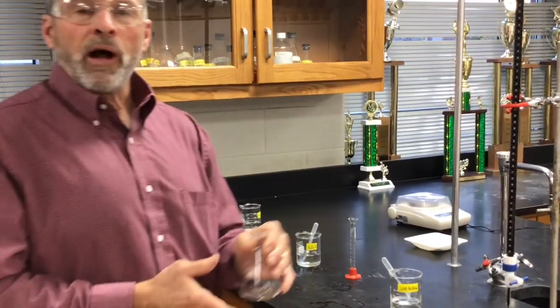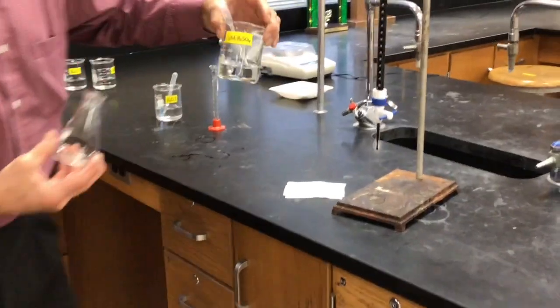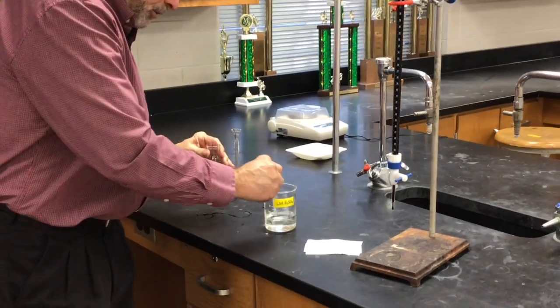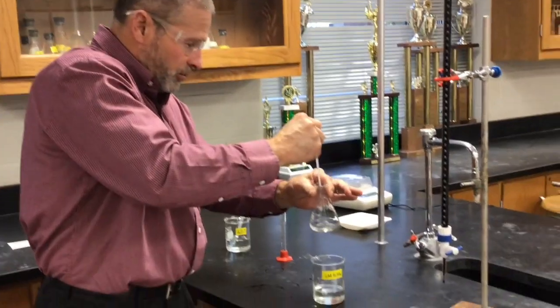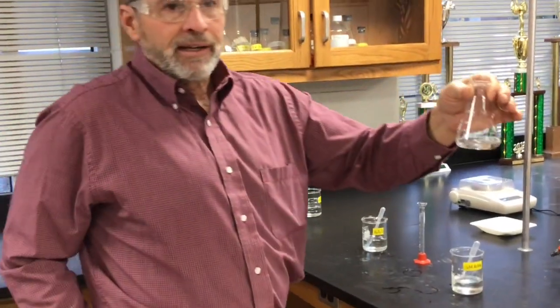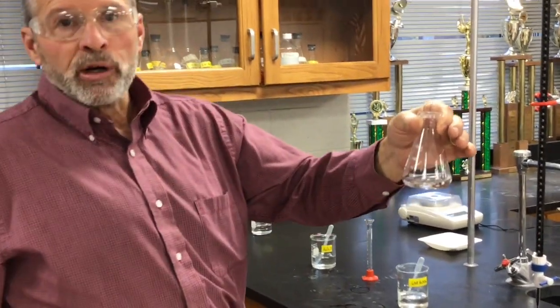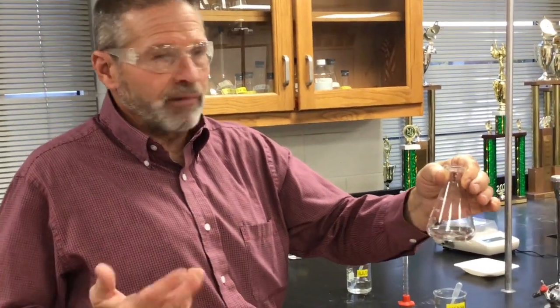Now, as you well know, these aqueous redox reactions tend to be in either an acidic or a basic solution. This one has to be acidified to work. And so Mr. Moore made up some 6 molar sulfuric acid, and we're going to give a couple good healthy squirts because we need hydrogen ions to make this reaction work. So you're not measuring the sulfuric acid. Right, we don't need an exact volume of it, we just know we need a big excess of hydrogen ions. The sulfate ion from the sulfuric acid doesn't make any difference, it's a spectator.